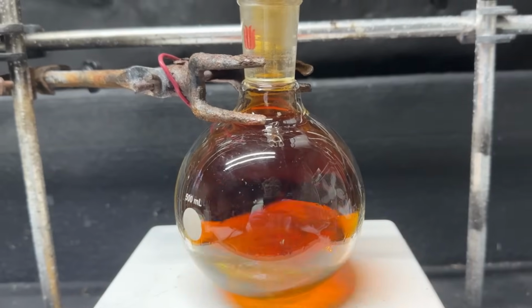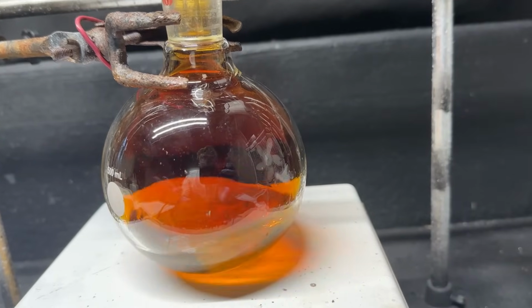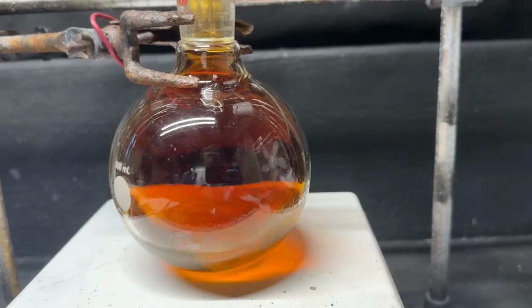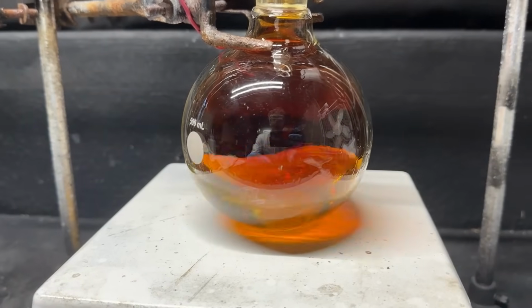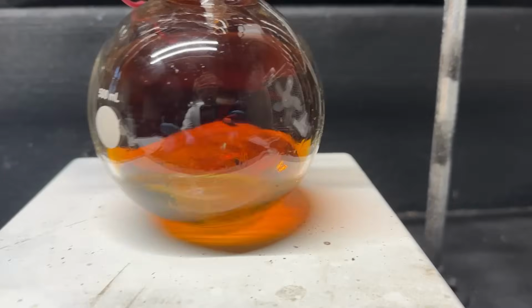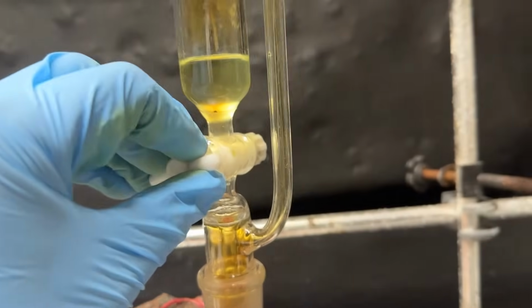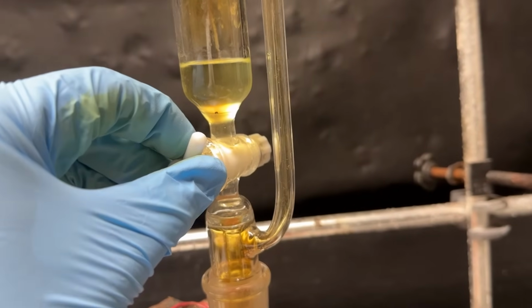Okay, so we're getting to the end of it. I'm catching little whiffs of it, and it does have a BO-like odor. So I'm excited to see once we extract the pure compound what that smells like. Anyway, so we got to go in there. It's all the alcohol we have left. It's pretty cool now, so I'm going to go ahead and add a bit more.